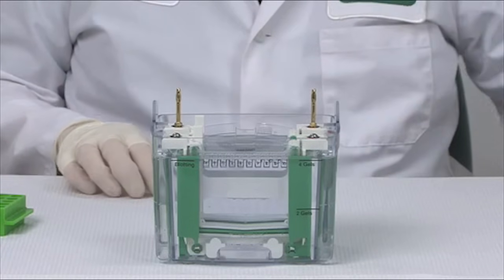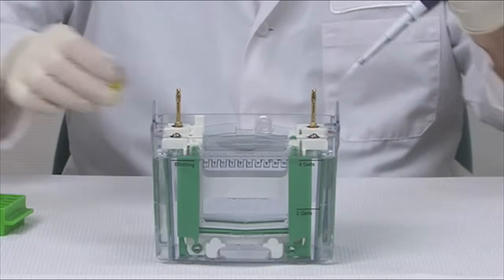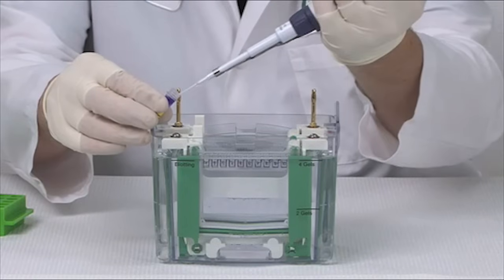Now you can load your samples. In this case, I'll be loading the Precision Plus Dual Color Protein Standard.